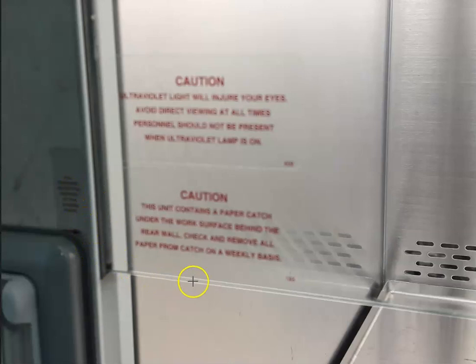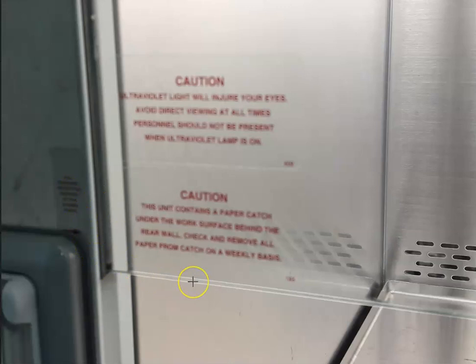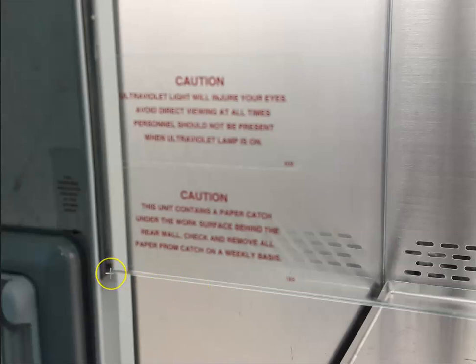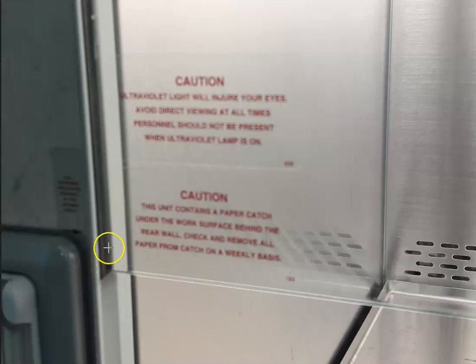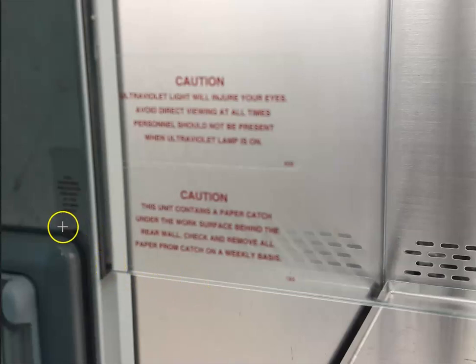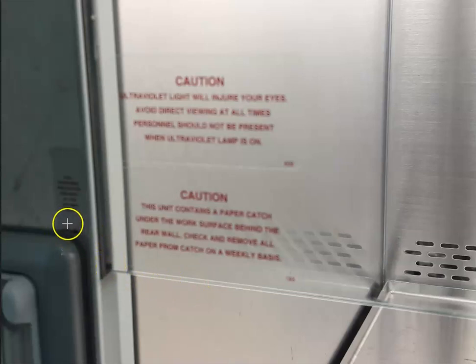This is the sash, or the glass panel, which protects the user from the biological agent. It should not be extended beyond the range of the indicated arrow, or else there will be a disruption of the airflow.